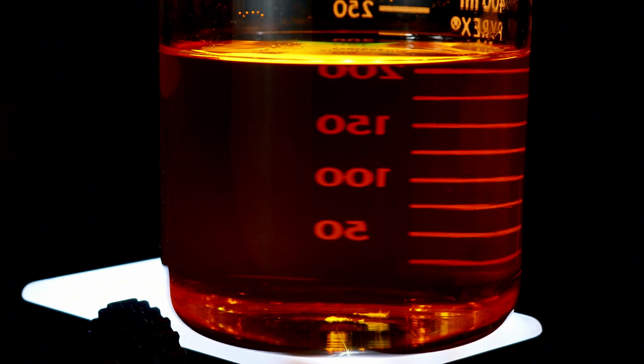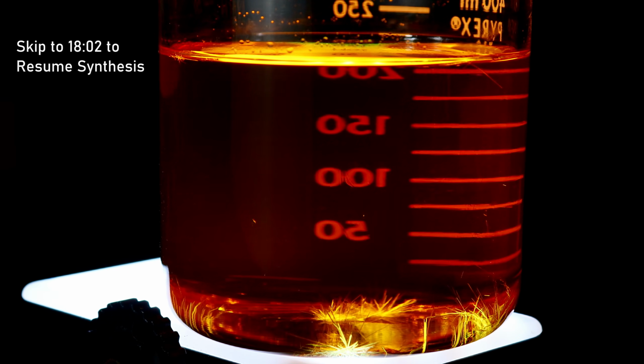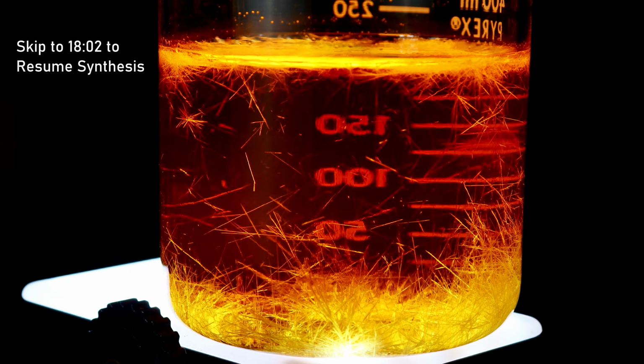I thought these were the most beautiful crystals that came out of this entire project, so I'm gonna go ahead and let this play out. If you want to skip this and go ahead and get on with the synthesis, feel free to skip to the time shown on screen.